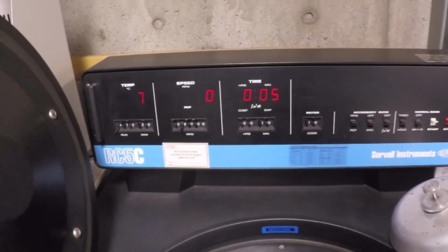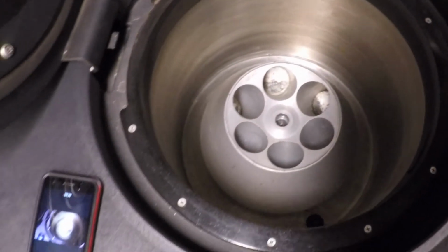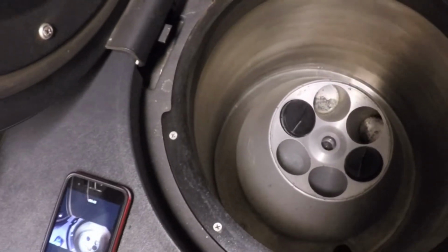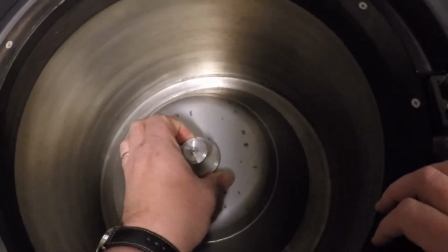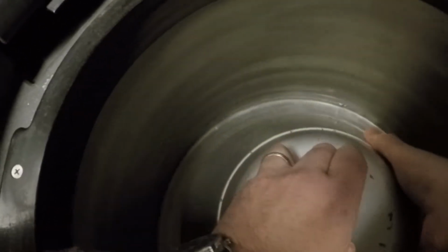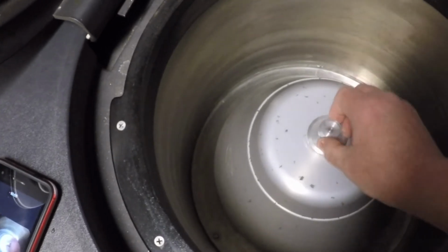So again, put our pieces in. Make sure there's no ice on them when you put them in. Opposite sides. We'll go down to the bottom, grab this, stick it down, lift up this top piece, grab the bigger piece with your fingers, hold the rotor and turn it to the right. There. And then the little piece is loose. The top, this one's good. The little piece is loose.